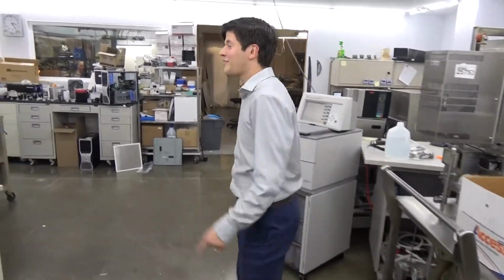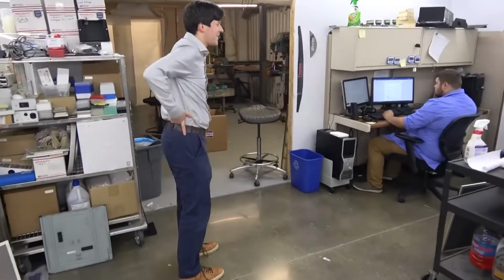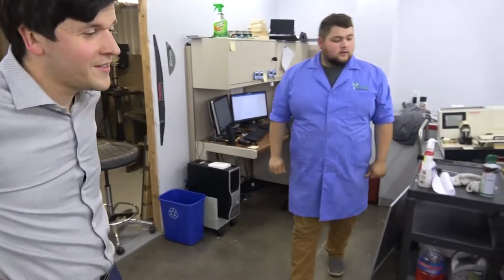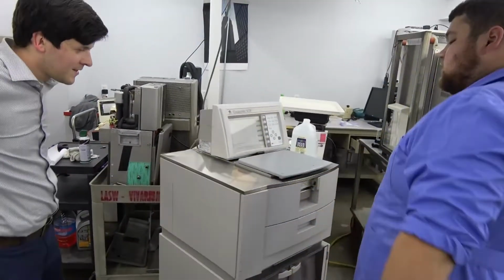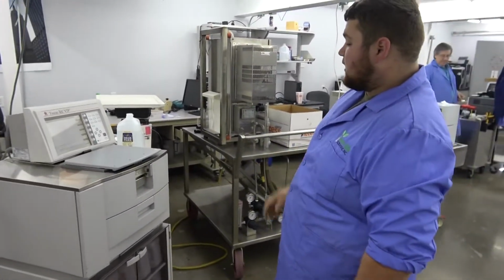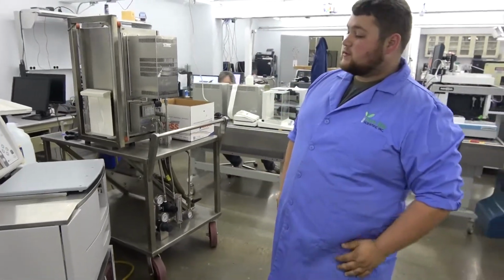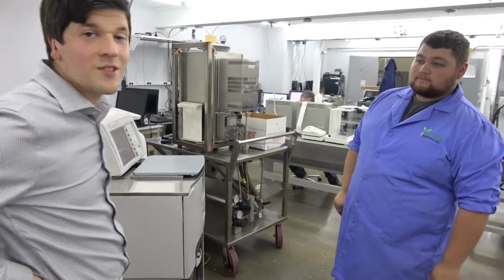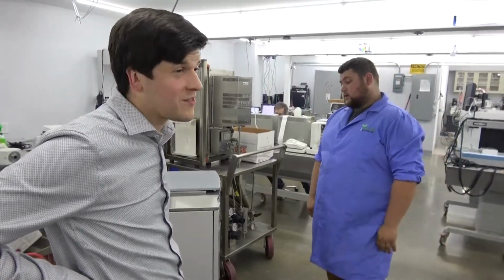Thanks, Steve. We're off to Mark's because Rob's here. Rob, what did you decide you're going to show and tell us today? I got this VIP 5 pretty much all set here. I can show you our finished product and the bones and pieces of what we have left from the two units we combined to make this one look and function as well as it does. It's kind of not fair because this one's already spoken for, so we're just tempting you. Everybody wants a VIP 5.